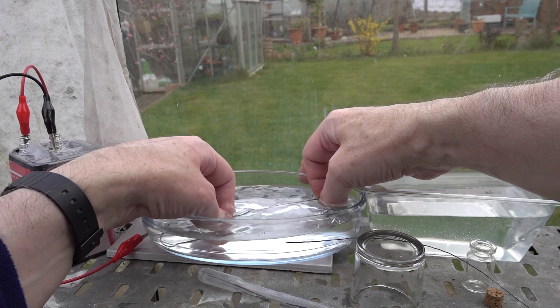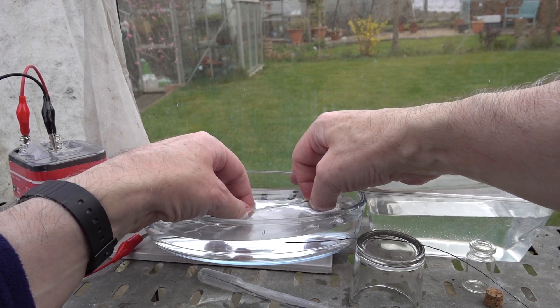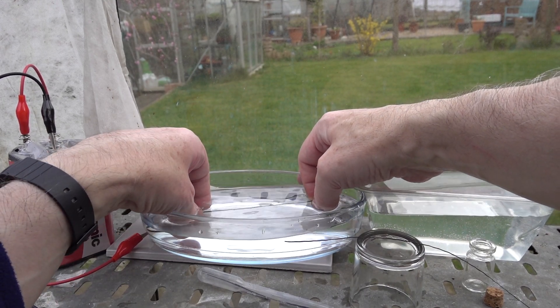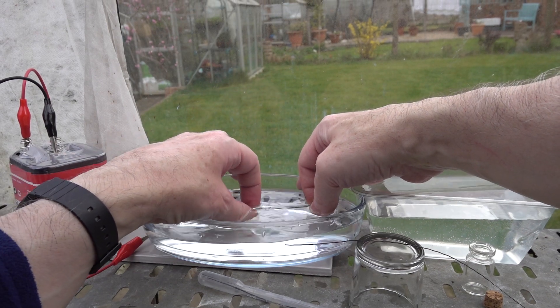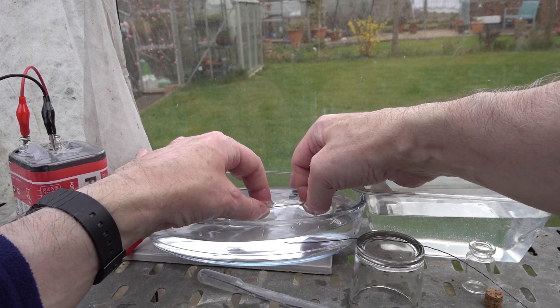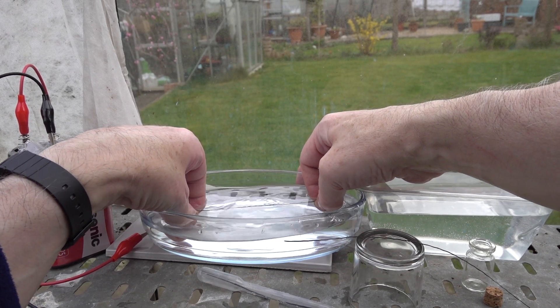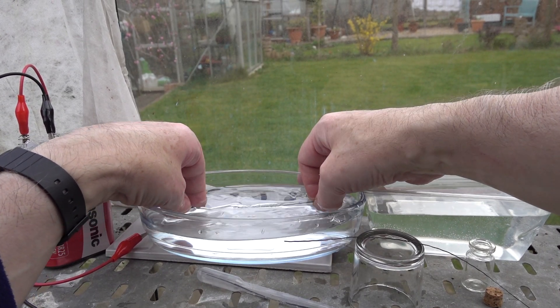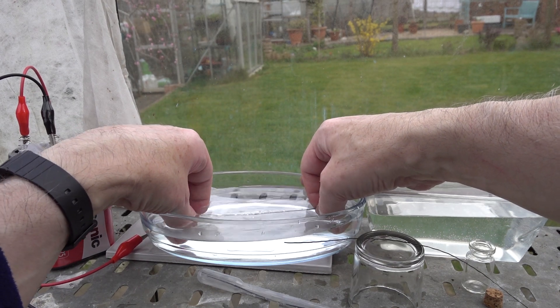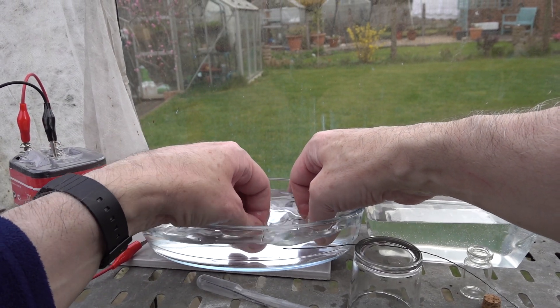The last little bit, a little bubble, you often have to chase it along with your fingers and try and get it out somehow. Make it come out through those holes. There we are, there's an electrode. Almost got all those bubbles out. There we are, there's the electrode.